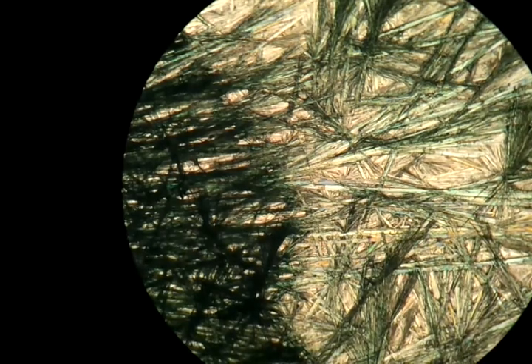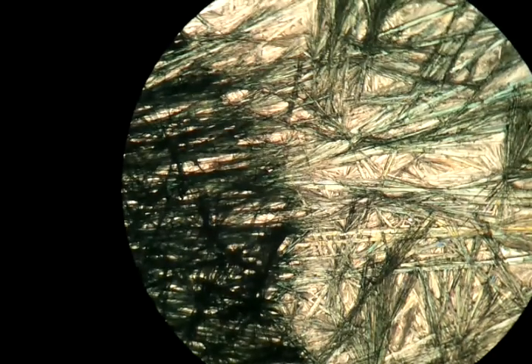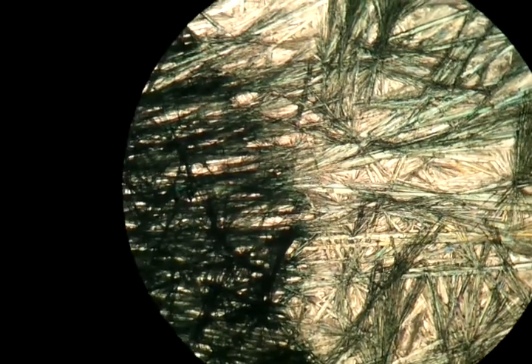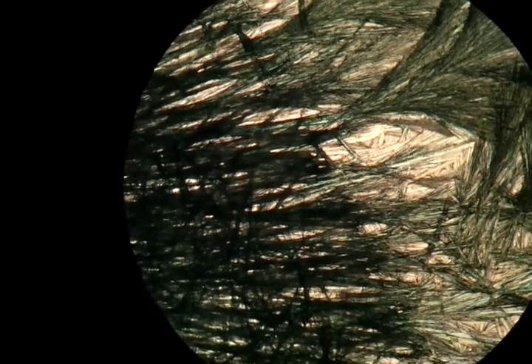As there are more lights all the time, turning the disc further. This is another place of the supersaturation edge, where it stops being cut off and starts being continuous growth.